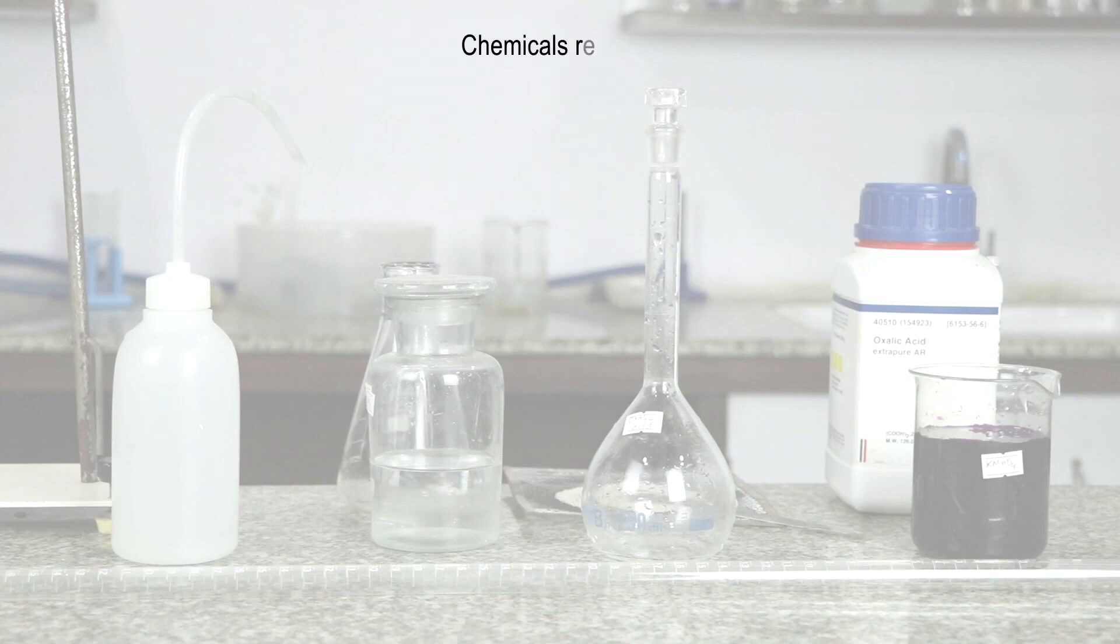The chemicals required for today's experiment are potassium permanganate, dilute sulfuric acid, and oxalic acid.